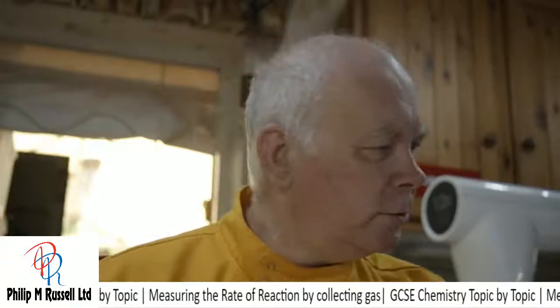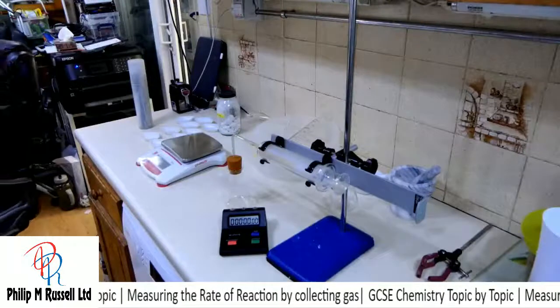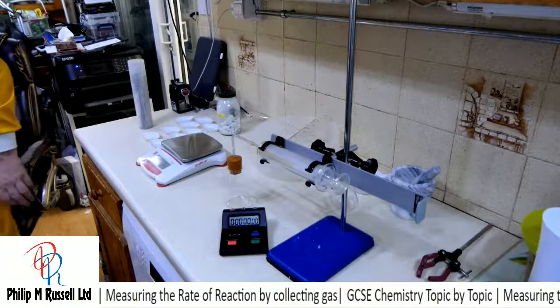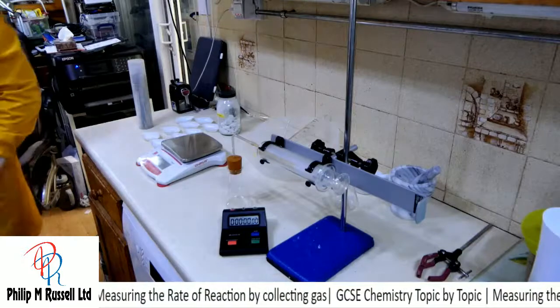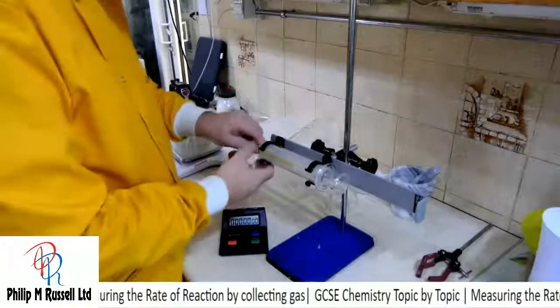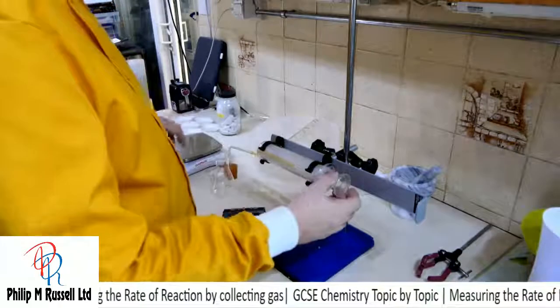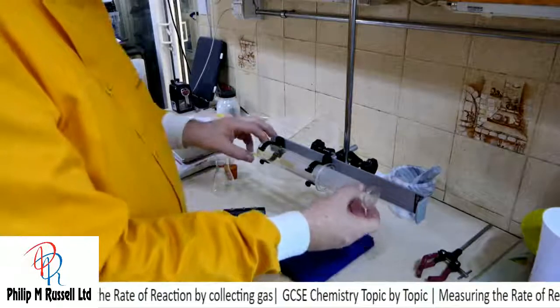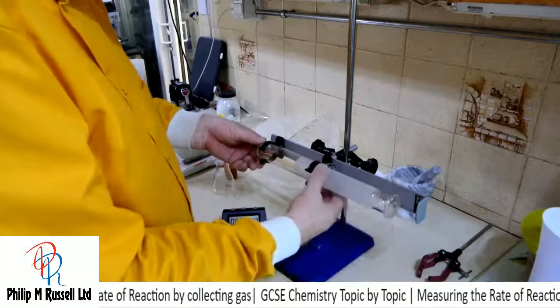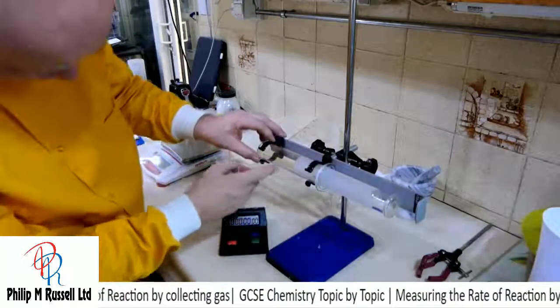So let's have a look at the experiment itself. What I have here is a gas syringe. The gas syringe, if I just disconnect it, here is an airtight syringe, and it holds about 100 centimetre cube.